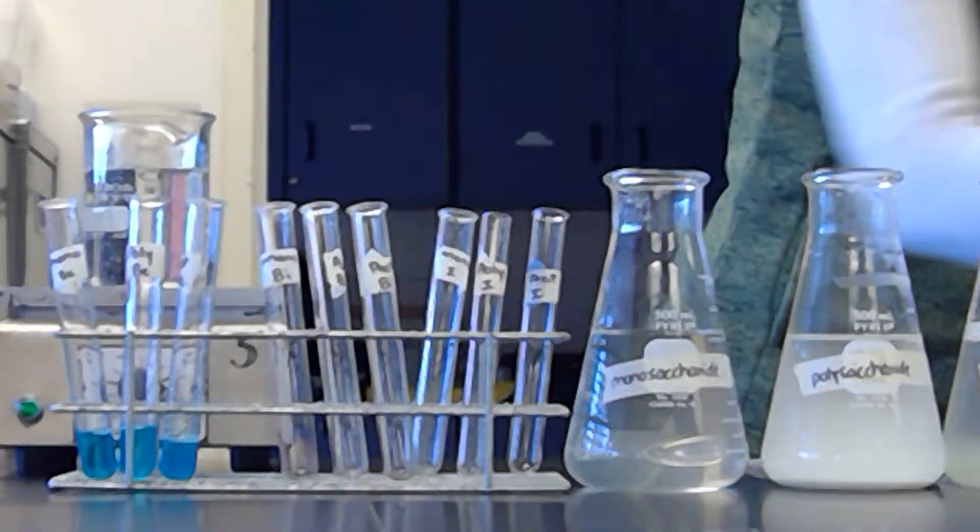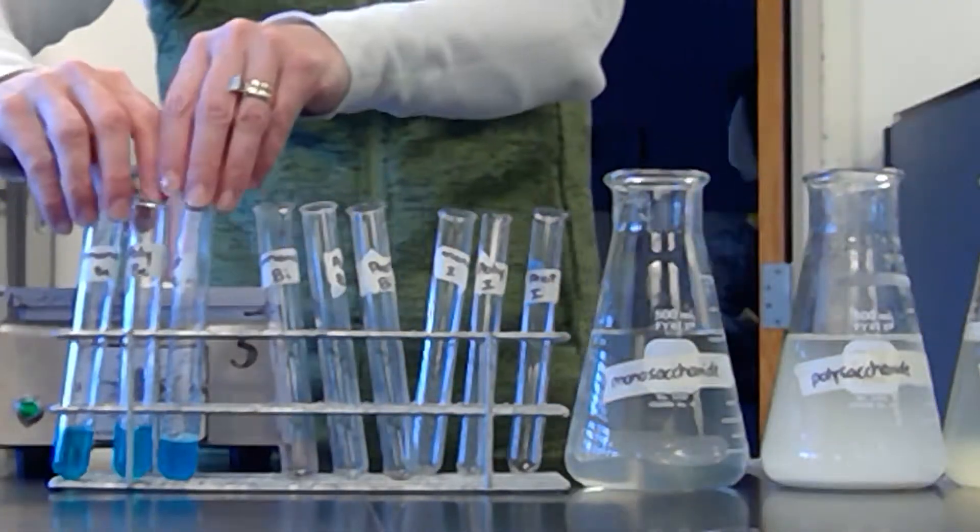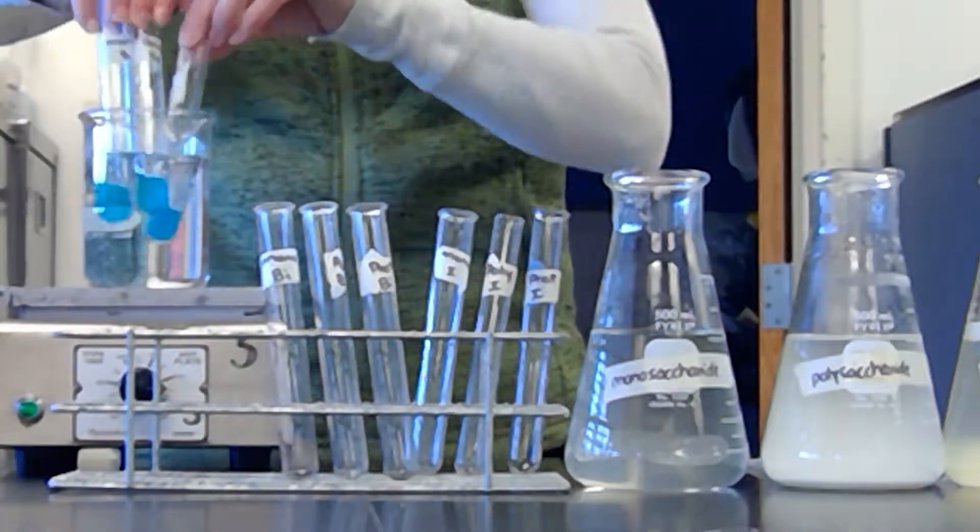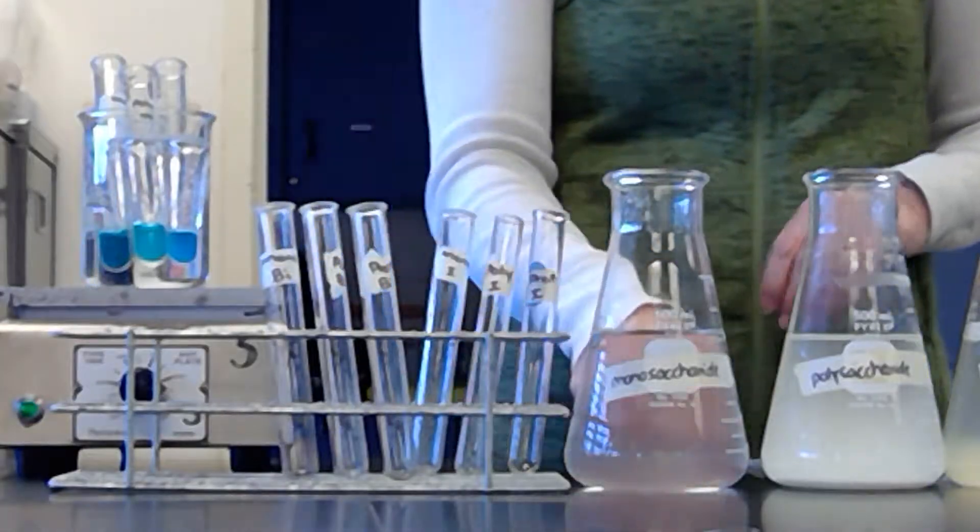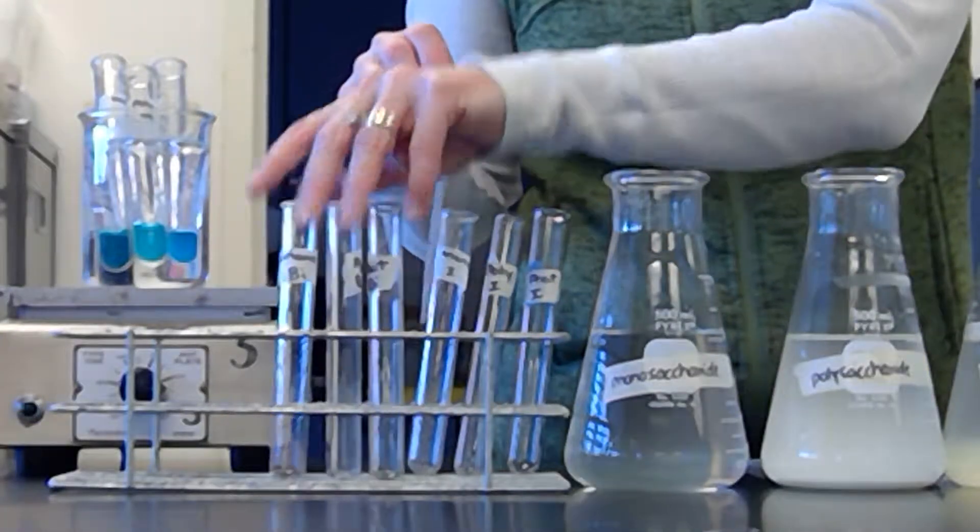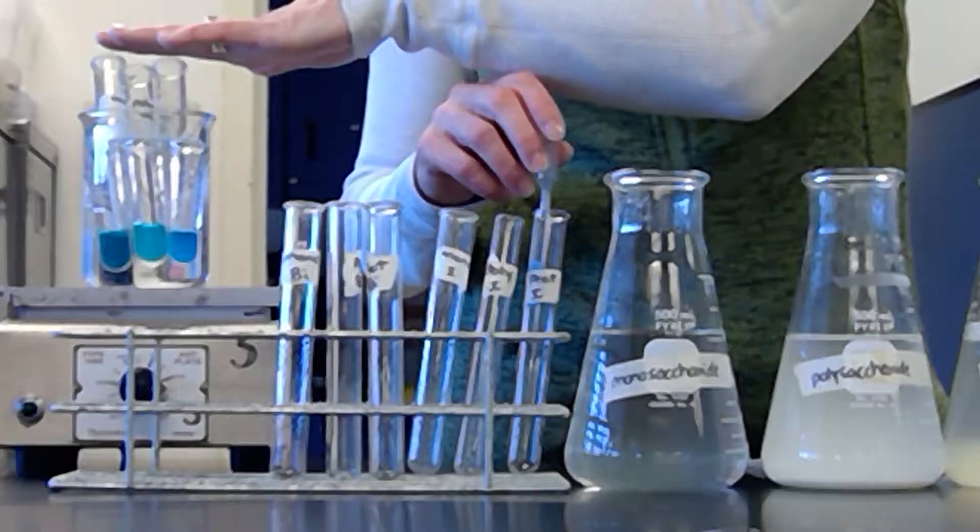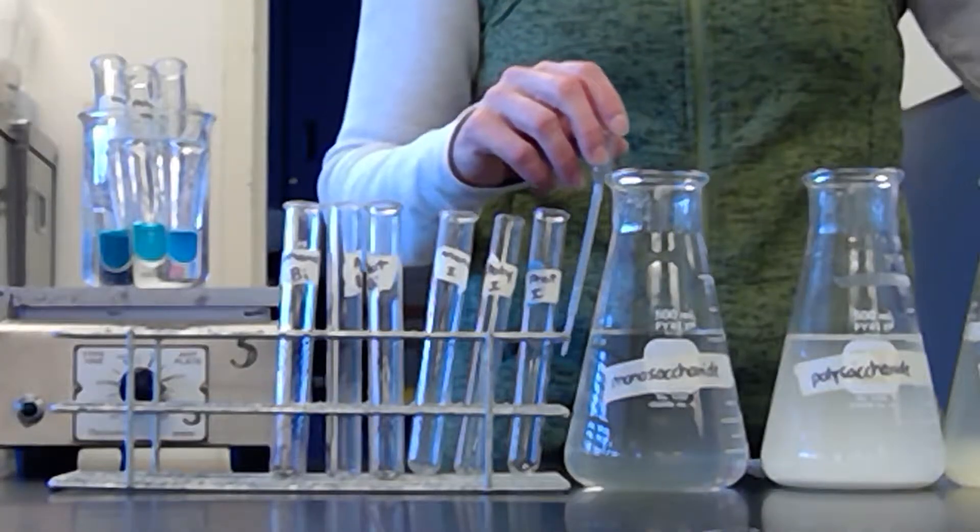And then I'm going to take these, give them a little swish, and then we're going to sit them in there and do the other ones while we're waiting for that to do their little reaction. So then these are Benedict's solution.